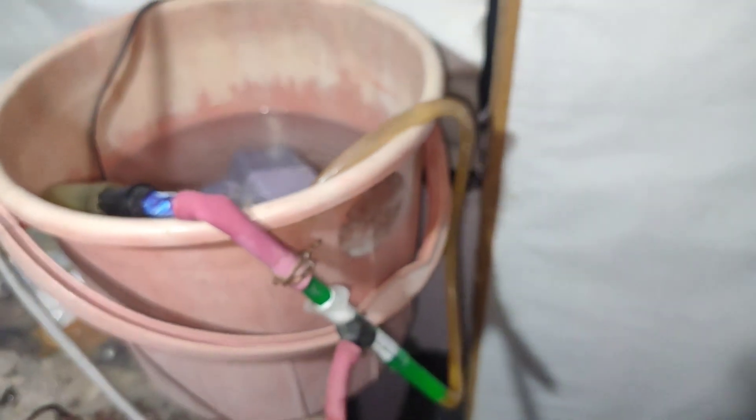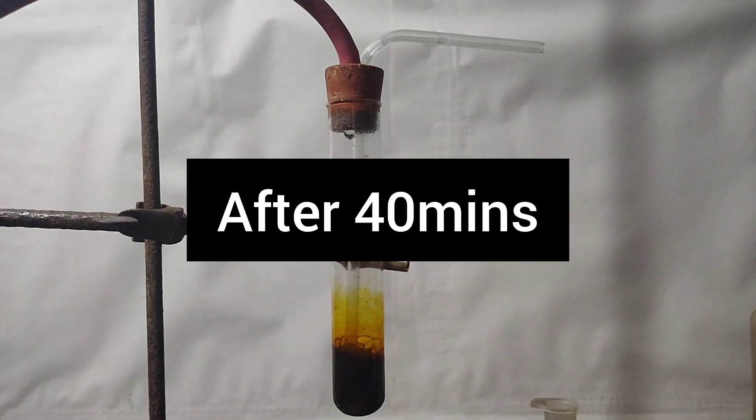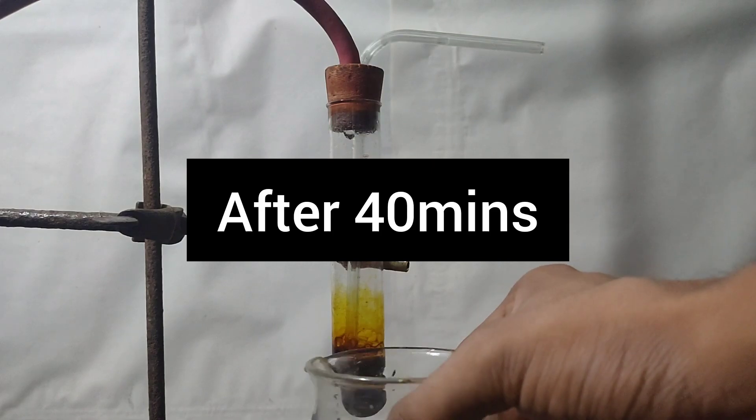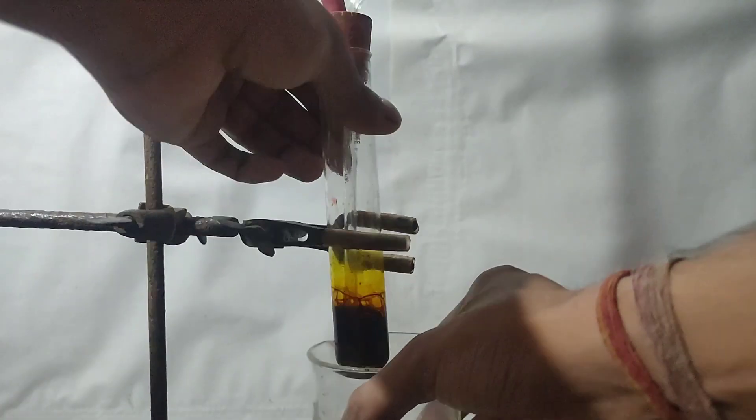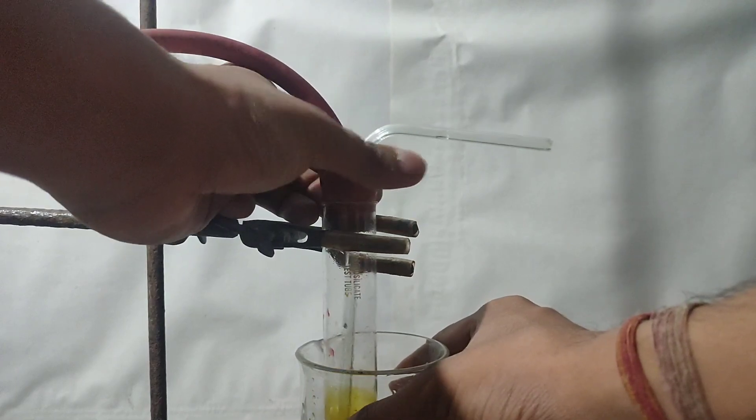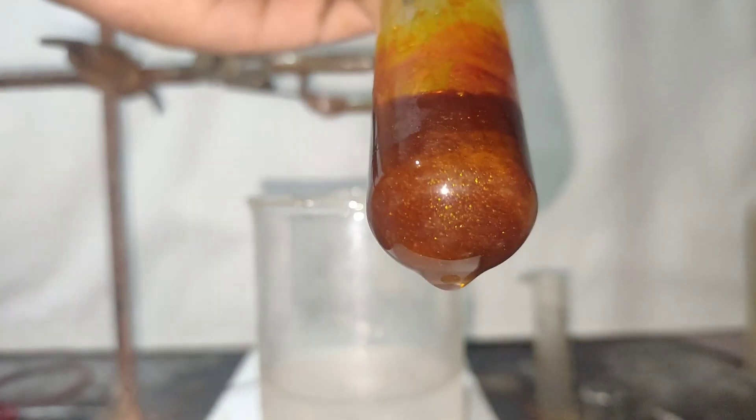After 40 minutes, I cooled the test tube in an ice bath and removed the cork from it. On cooling, you can already see that some yellow crystals have formed.